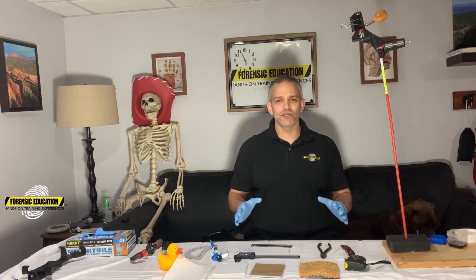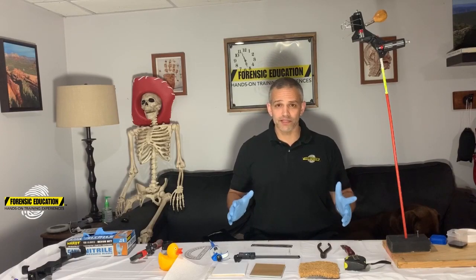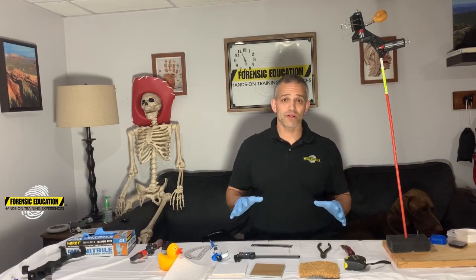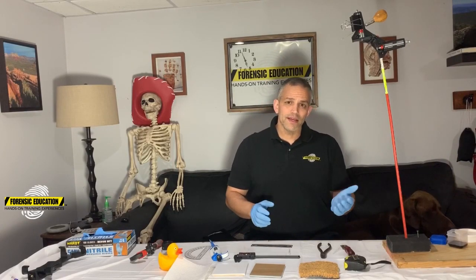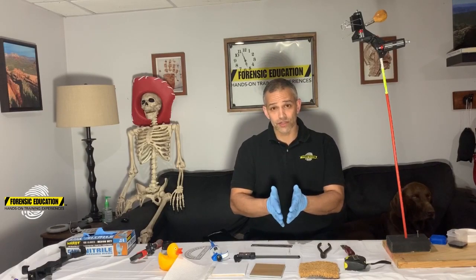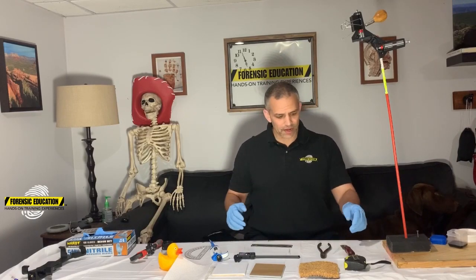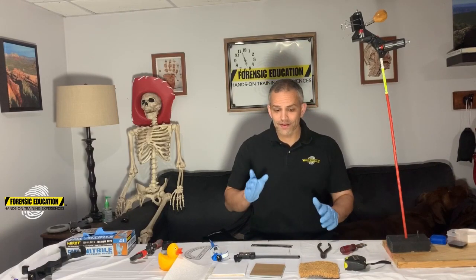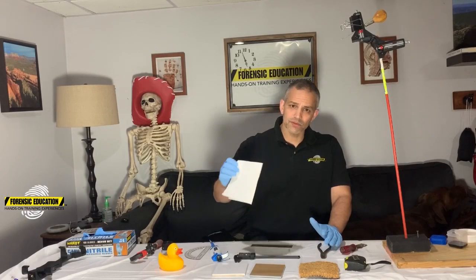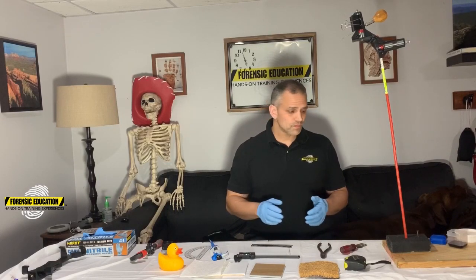Hey everyone, welcome back to Forensic Education. I'm Dr. Mike McCutcheon and today I'm going to do a little experiment using blood stains. These are experiments that you can set up in your classrooms, have your students do, or even do at home. We're going to look at how height can change the size of your blood stain, how different objects affect the stain, and how different surfaces change the size of your blood stain.